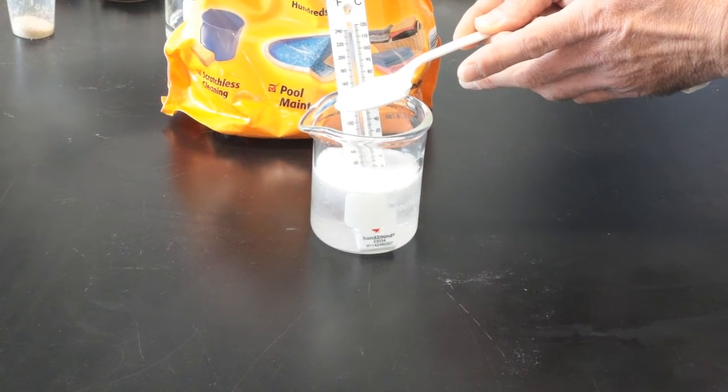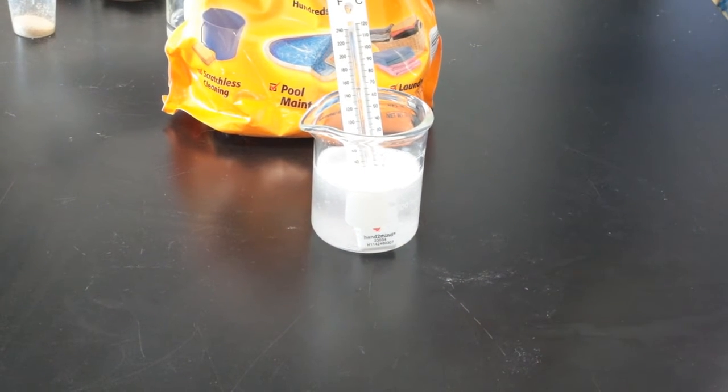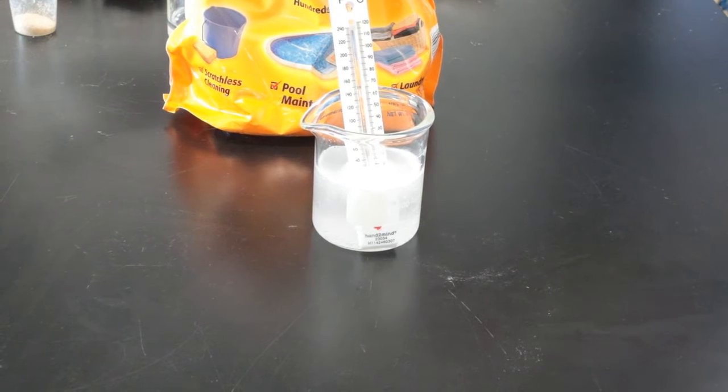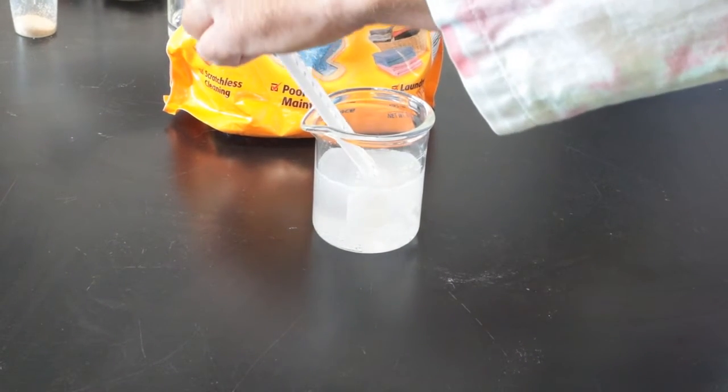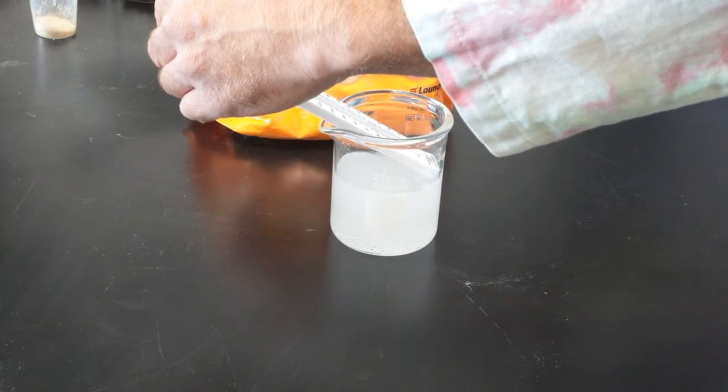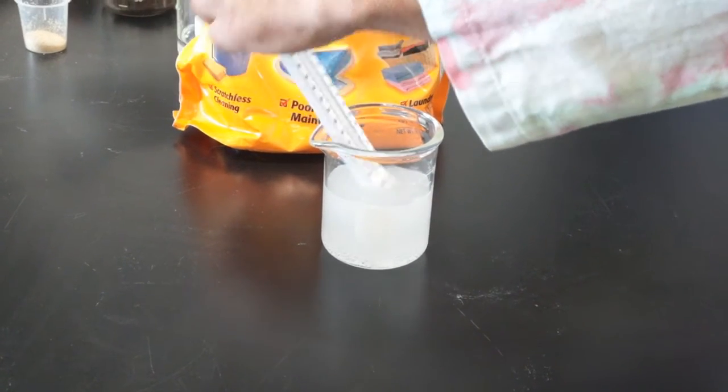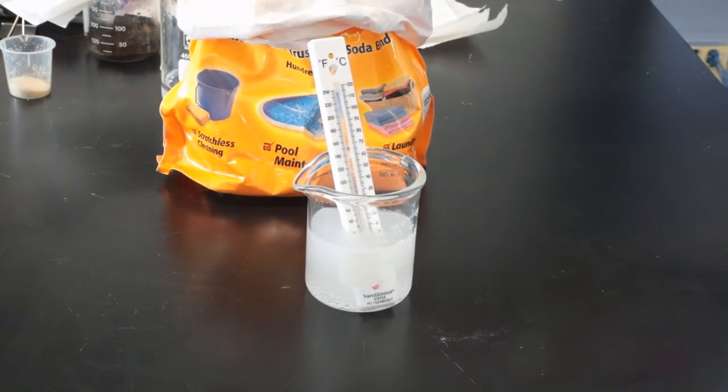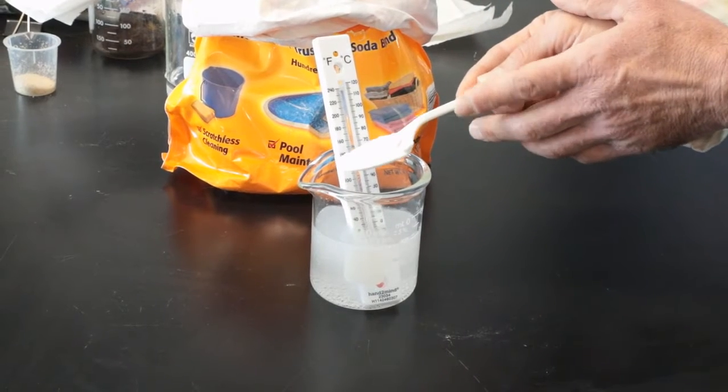Stop. Let's take initial temperature reading before we add any more. What's the initial temperature in Celsius? We're using Celsius. It is about 15. 15 degrees Celsius.